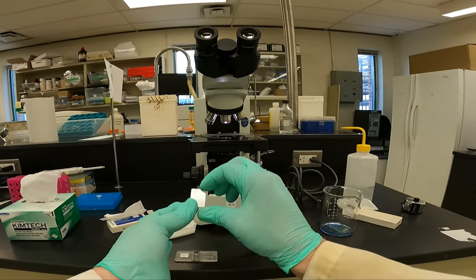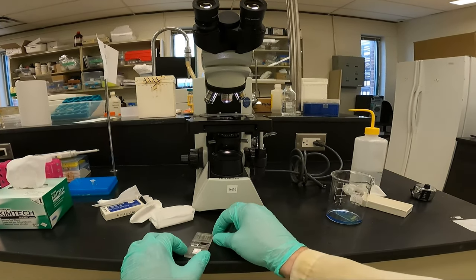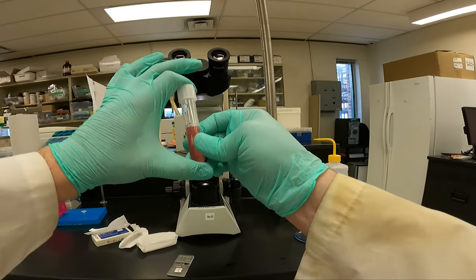To begin, we'll place the coverslip on top in portrait view. And then we'll take our sample, our cells.